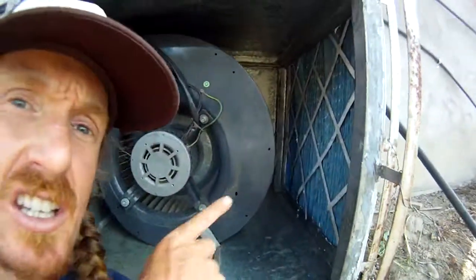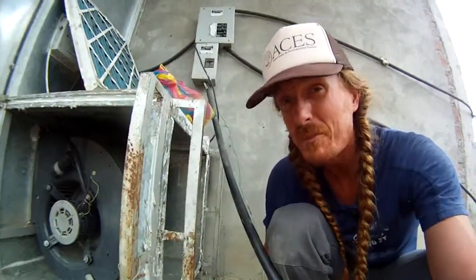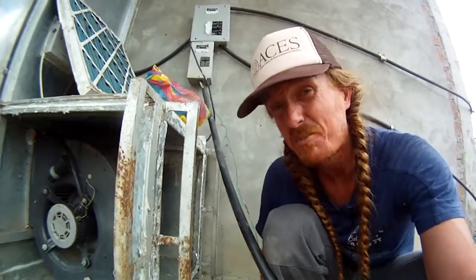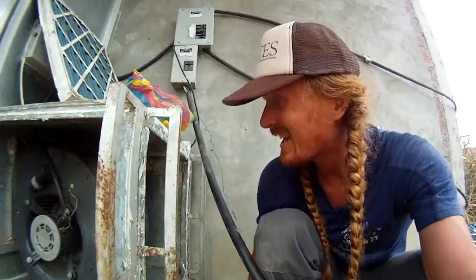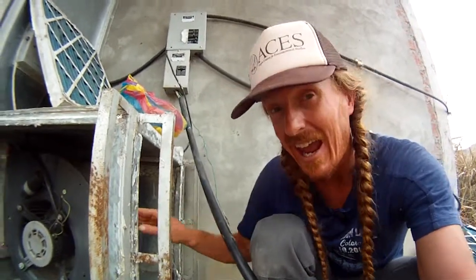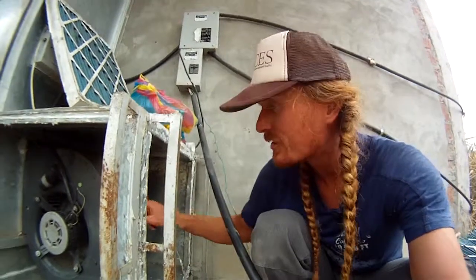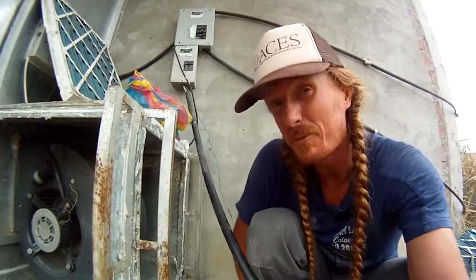Alrighty, y'all, here we are. I pulled off that filter. You can see the backside of the other filter. I've almost got that off. But yeah, just want to show you inside. So this is a blower. When buying a blower, it's very important to spec out the right specs. You're gonna have to do a little math. It's gotta be able to blow against resistance. This has 1.2 inch static pressure resistance, so that means it can handle the resistance of all these filters, mainly the HEPA filter. This is basically the workhorse of the lab. It's keeping the lab positive pressured with filtered air.